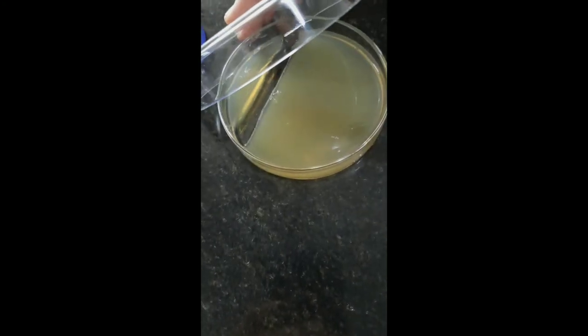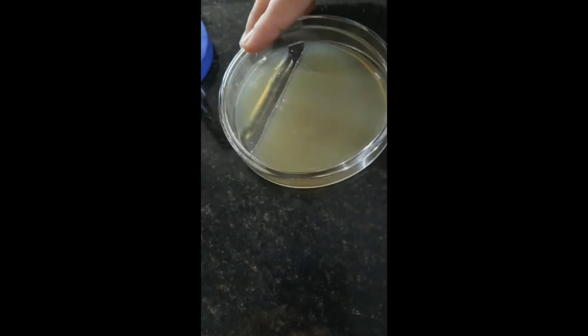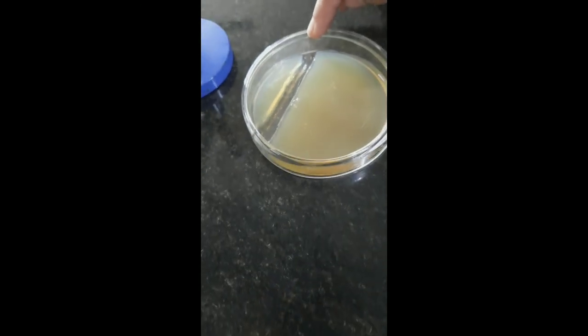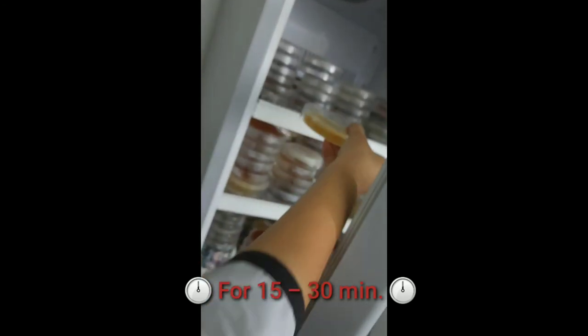We have to fill the antibiotic solution in such a way that it should not overflow the ditch. As you can see, it should not overflow from the ditch. Now we have to place this plate into the refrigerator for 30 minutes without disturbing.